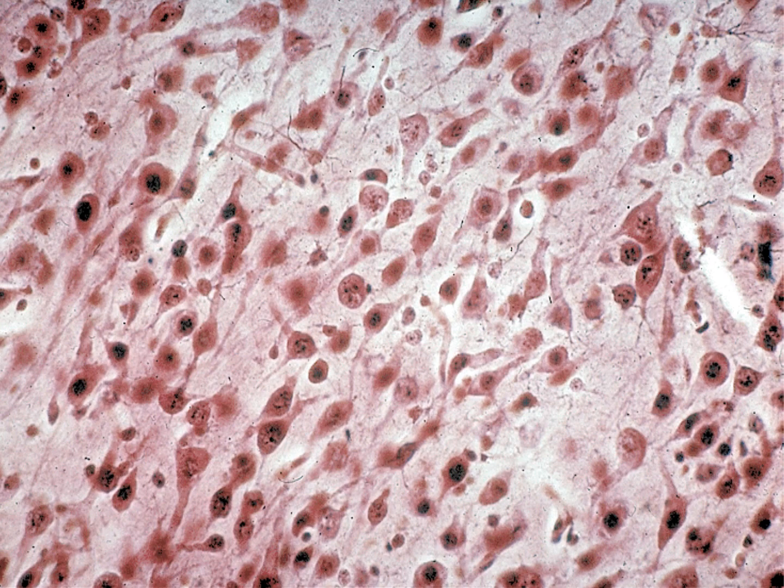Not a great picture here. This is a lower magnification of nervous tissue. These neurons here are easy to spot, but they don't have their really characteristic processes that really snap out and say, hey, this is nervous tissue.